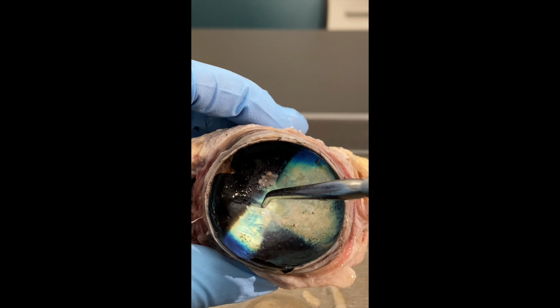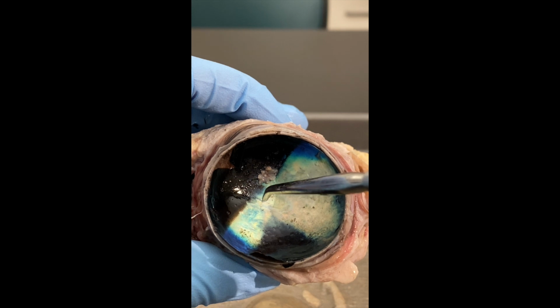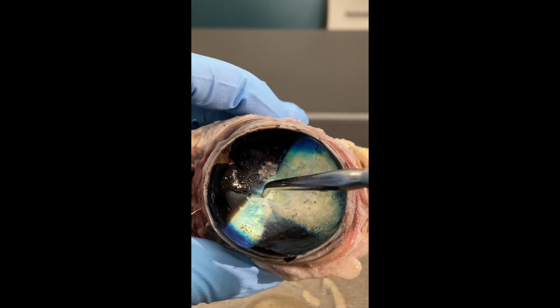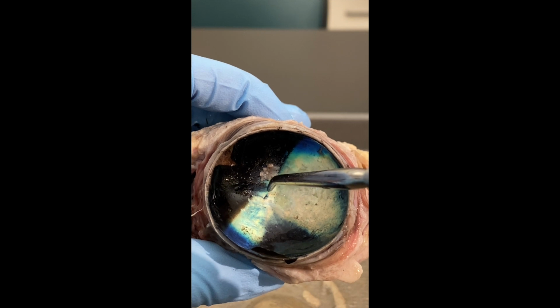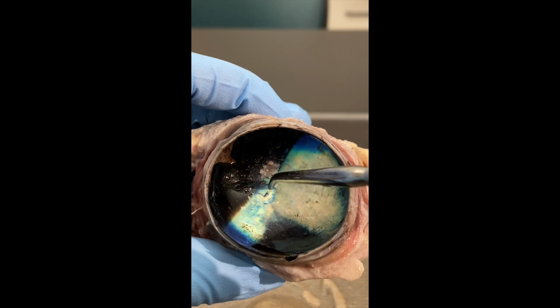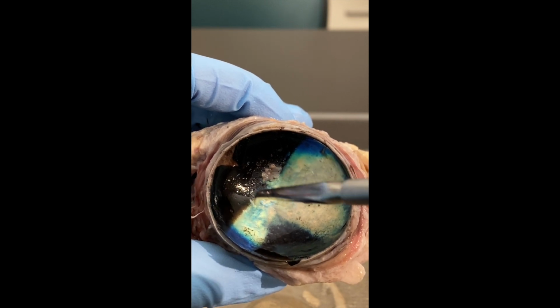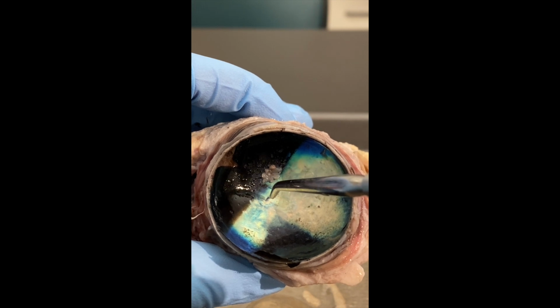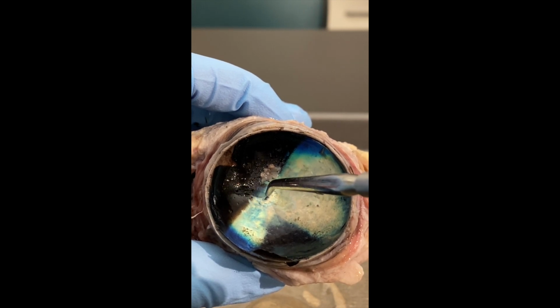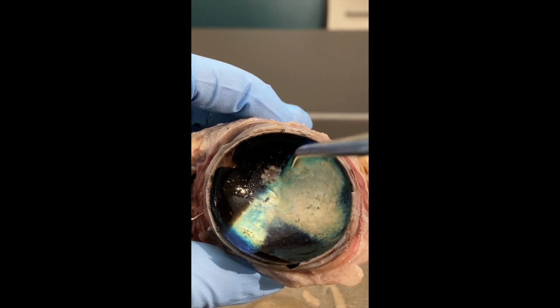Now right here, see that little black spot? It's actually an indentation into the layers. That little black spot is called the central fovea. And typically it's surrounded by an area, I'm kind of tracing around where you'd see it, called the macula lutea, which means a yellow spot. Now you can't really see that it's yellow here, but I have a picture that will show you the macula lutea and how yellow it can be in some of the eyes. But at the center of the macula lutea, you find this little black indentation, which is the central fovea. That's where all of the images you're looking at are focused to, right there.